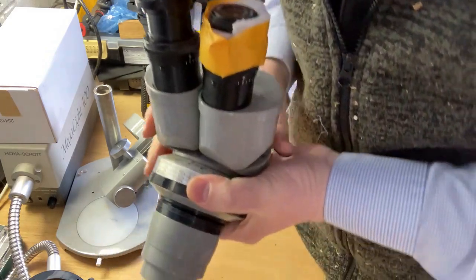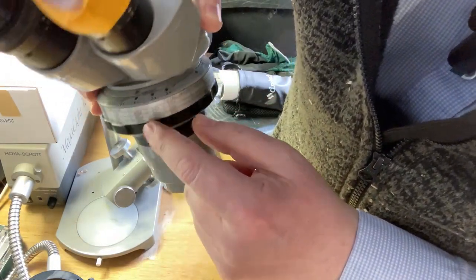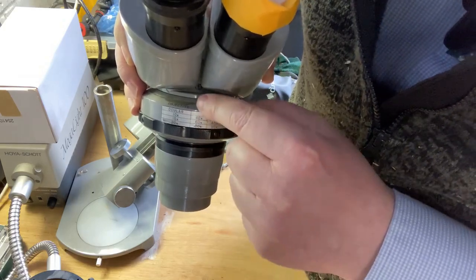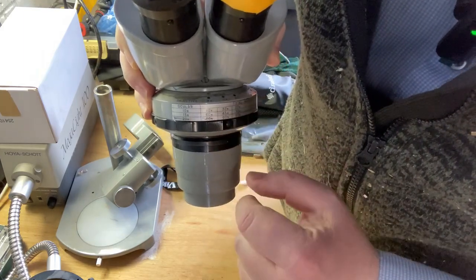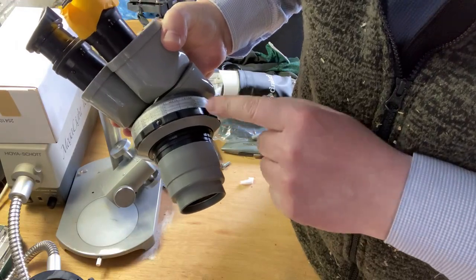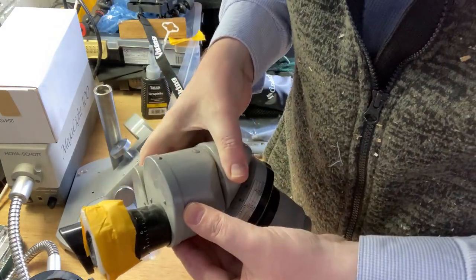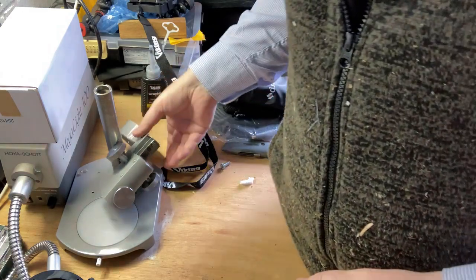So just here, you can see the 4 times objective is the highest, so if you actually adjust the ocular to be a times 20, you'd get 80 times, but because this is only a 10 times, then you actually only get 40 times magnification. So not a very high magnification. For now, I'm not going to be taking it apart, but as you can see, there's a variety of different screws with which to actually remove it. So I might do that at some point, but for now, I'm just going to have a little look here.